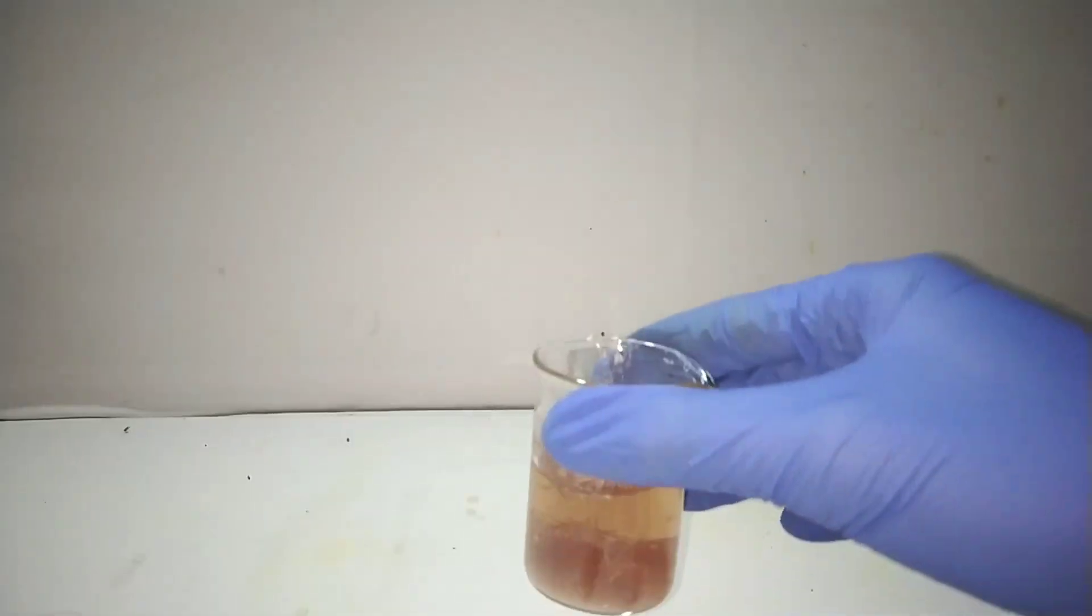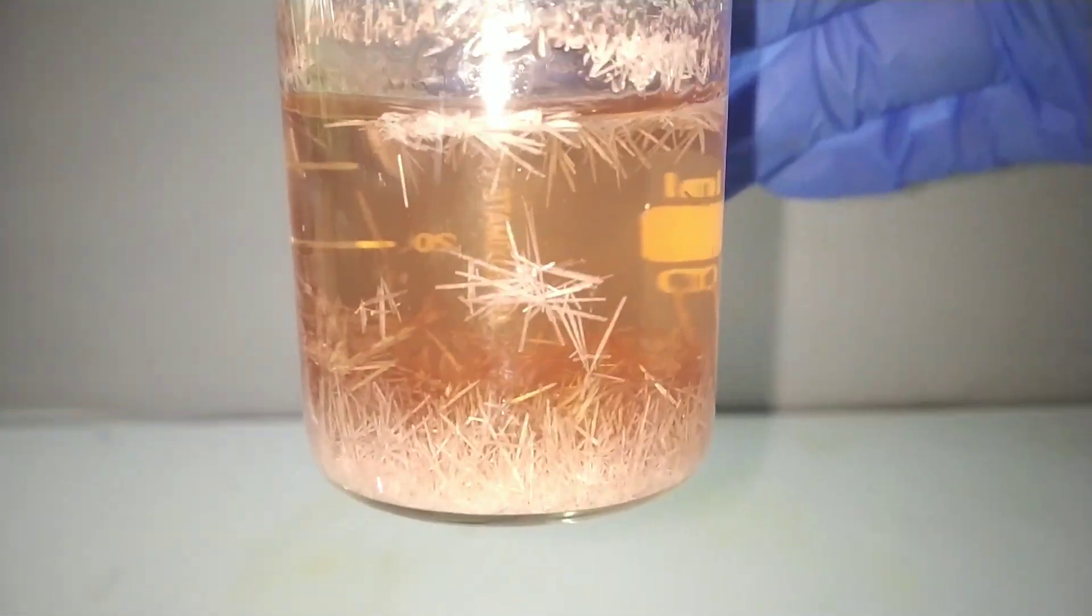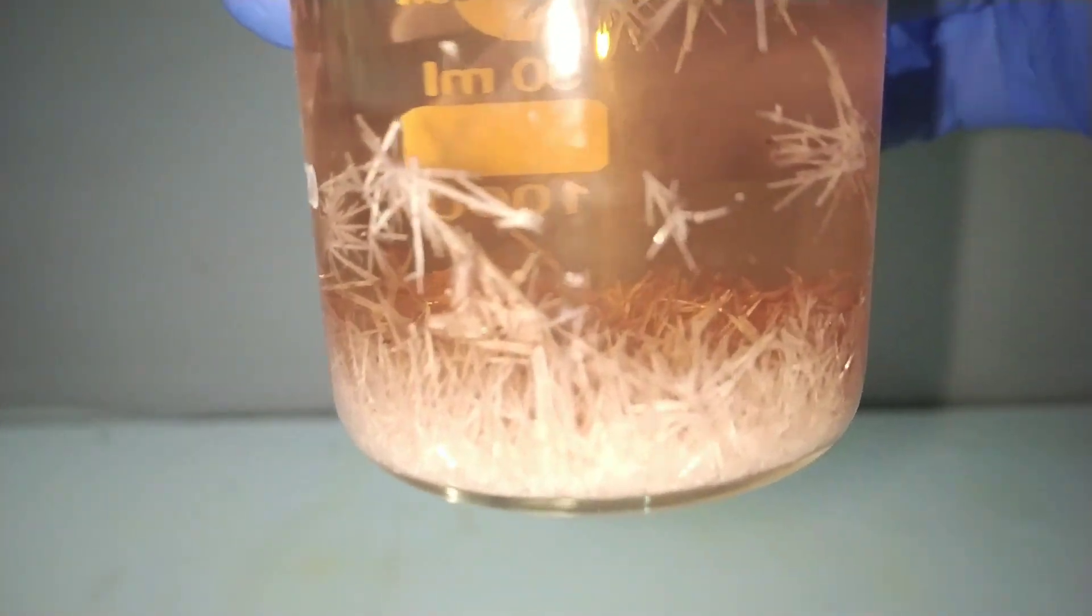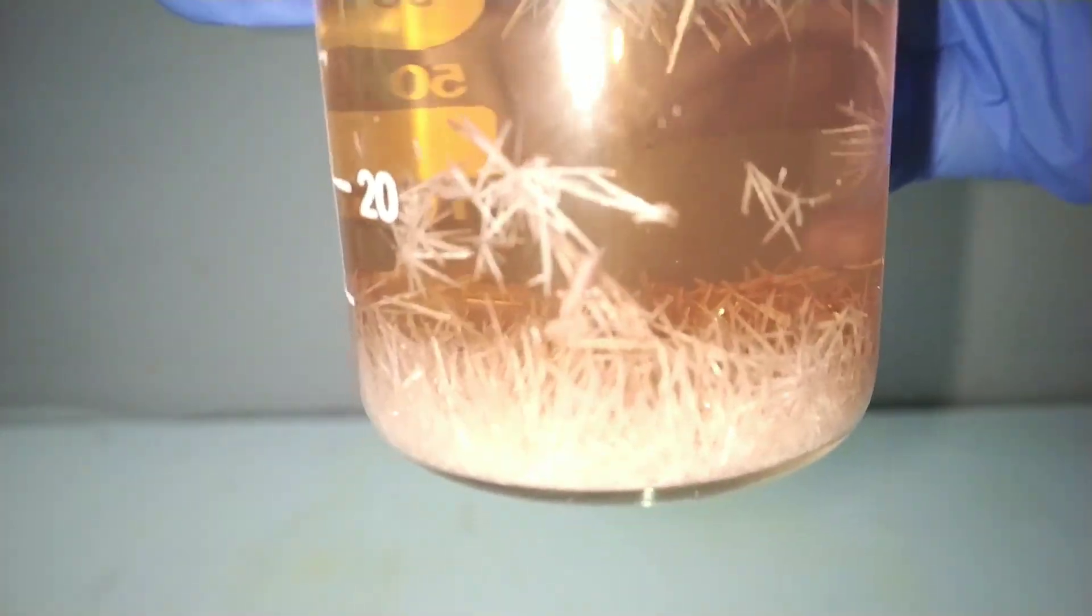It was then placed overnight undisturbed in room temperature. When the solution cooled down needle shaped crystals of parabromoacetanilide separated out.